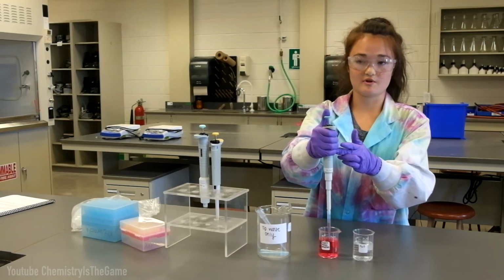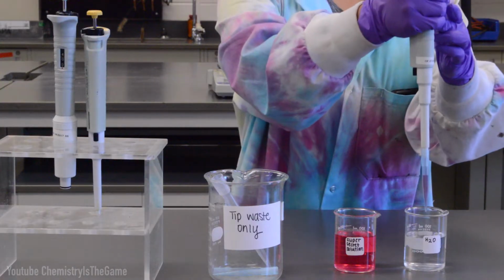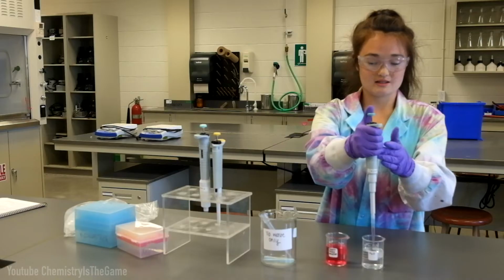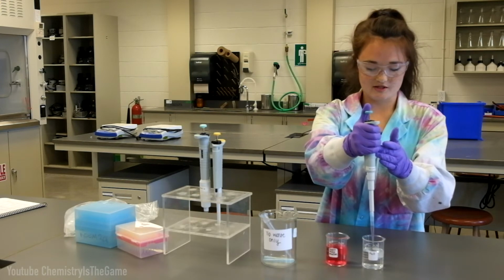evenly and slowly. Keep your thumb on top of the pipetter, and then move your pipetter directly over to the next beaker you want to pipette your solution into. To dispense, you want to press down all the way firmly until the second stop and do this evenly.